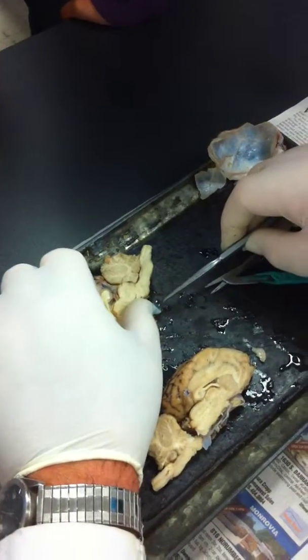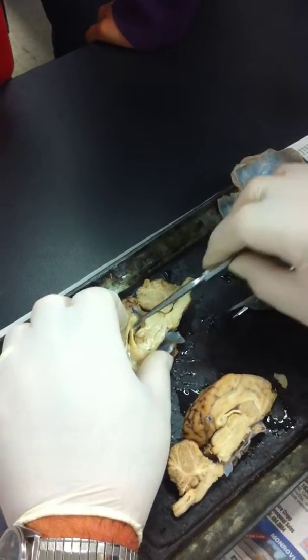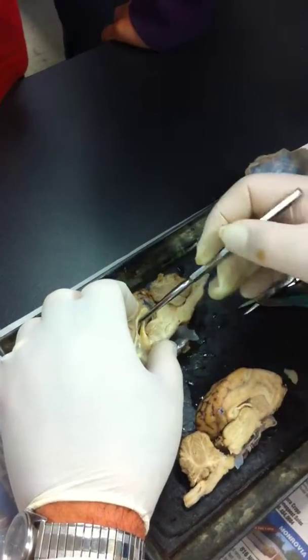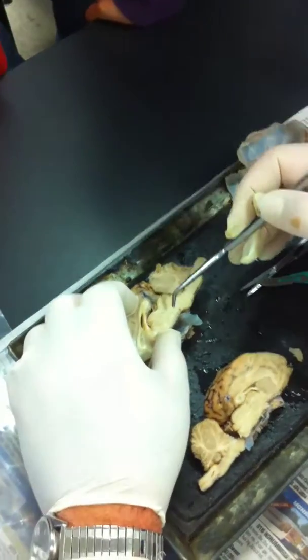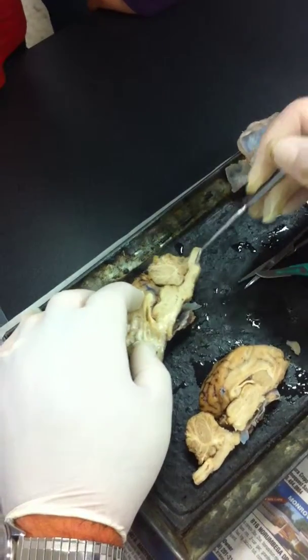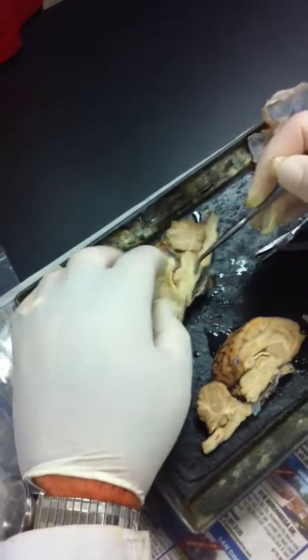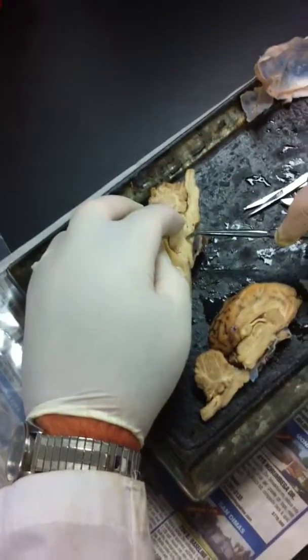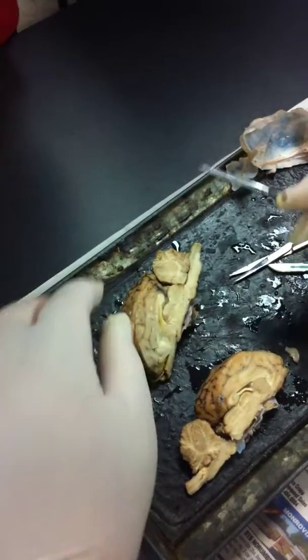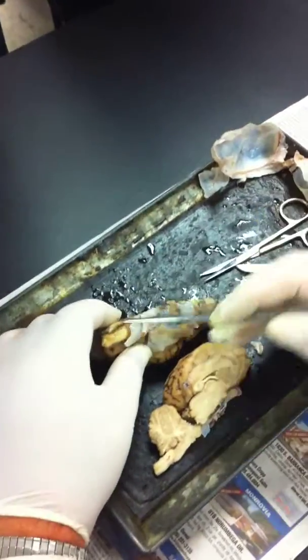See? Where was the lateral ventricle? Here, just where you start. It's between the corpus callosum and the fornix. What was that other thing you just mentioned? The cerebral aqueduct? Yeah, that's right at the lateral ventricle. No, it should connect with the third ventricle. Supposedly it says it doesn't have any space. See? What doesn't have space? The camera. Okay. Never mind.